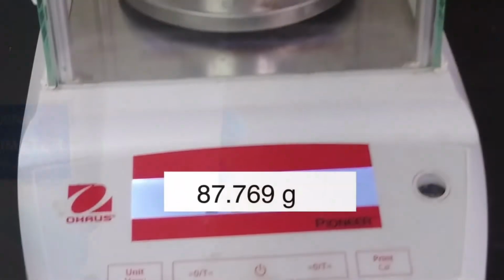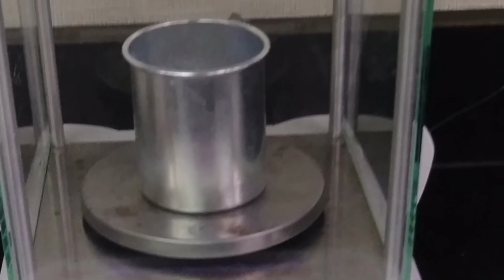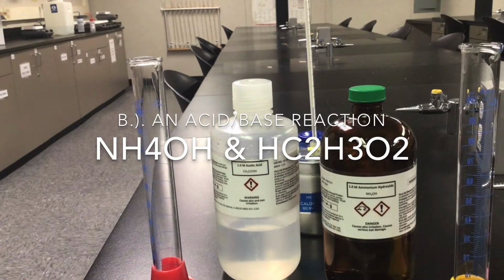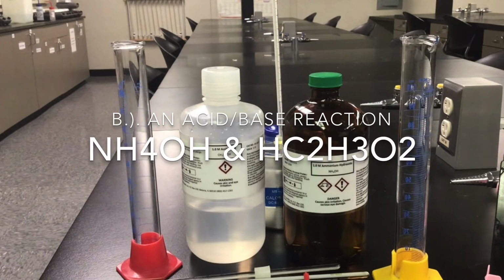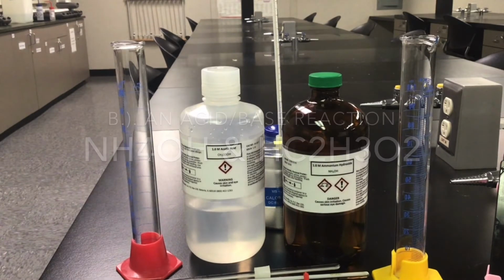Once the reaction is complete, you will record the final temperature and the mass of the solution. Please pause the video and record the mass of the solution and the final temperature on your report sheet. Next, we will do Part B, an acid-base reaction. For Part 1 of the procedure, we will use ammonium hydroxide and acetic acid to conduct the neutralization reaction.